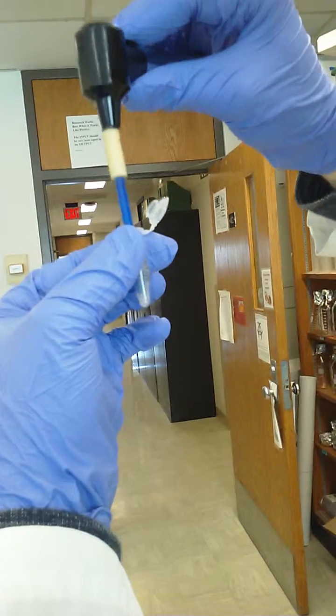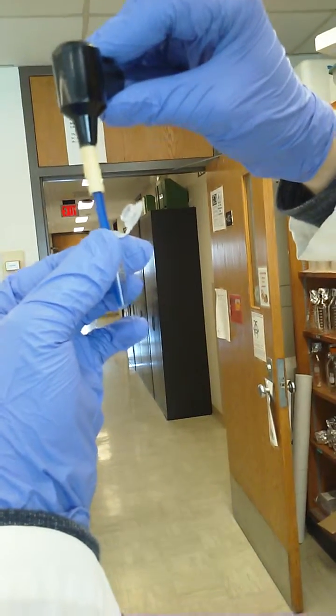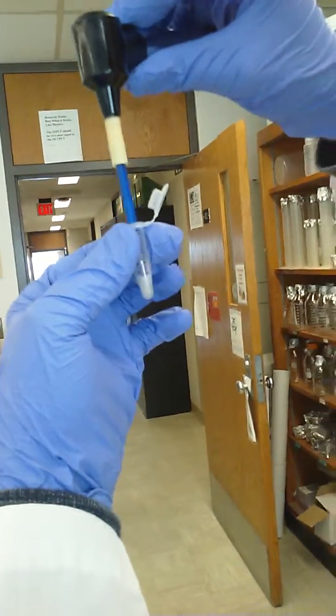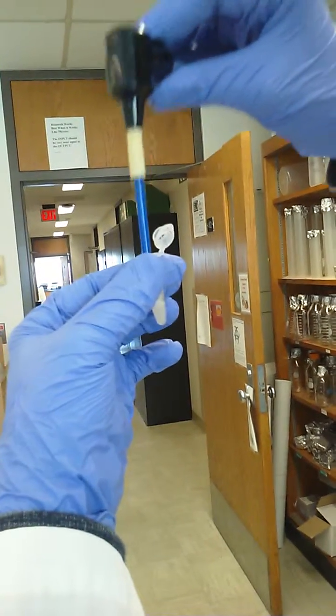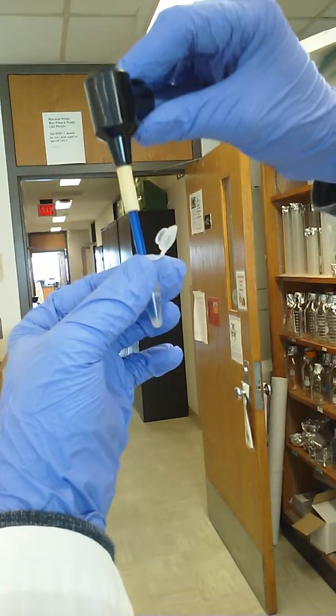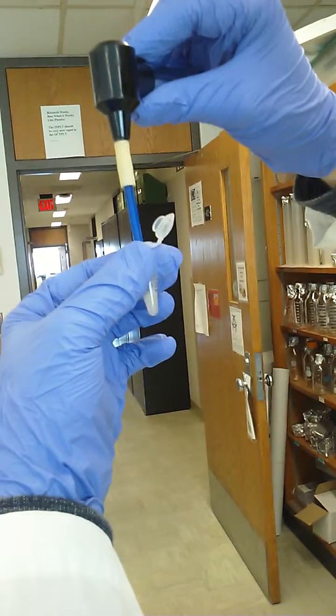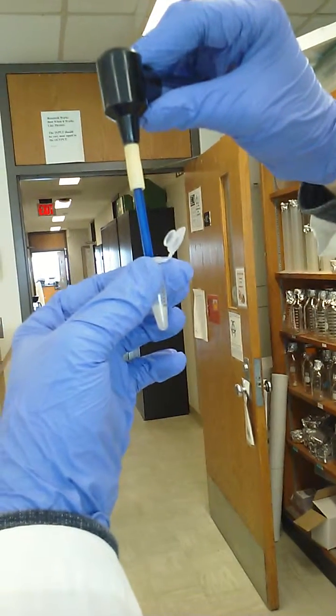And then just gonna homogenize it a little bit longer if one has to, to get the viscosity so that you're not pulling strings of liquid on the pestle. Because if it's too viscous, it won't work well in the next step of the kit, which is a pre-filter to remove insolubles.